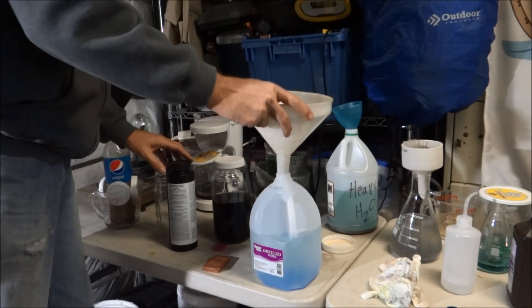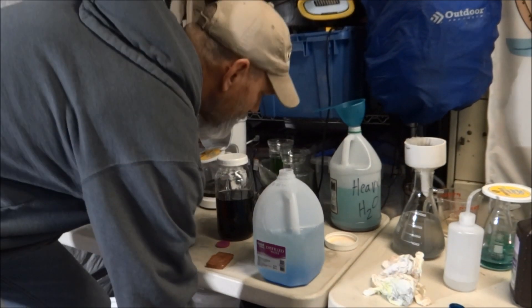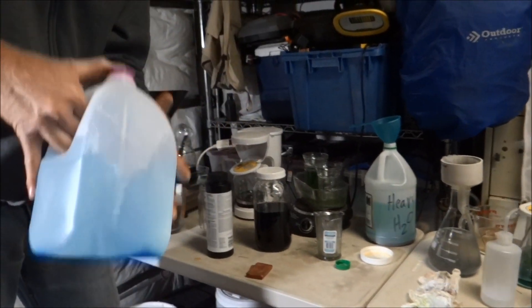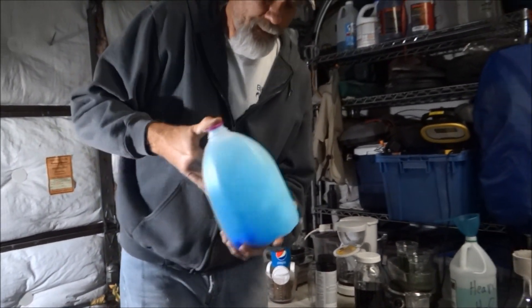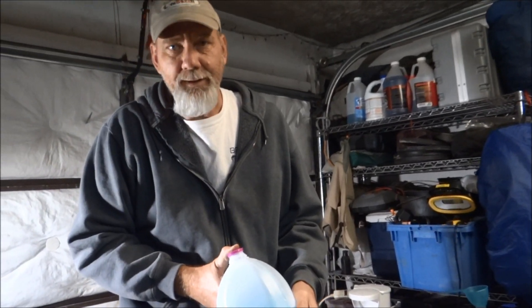I'm going to dissolve the copper sulfate in distilled water - just kind of taking the easy way out here, I'm lazy. We're going to make sure this is all dissolved. Look how beautiful - what a pretty blue! I'll keep shaking this until it's all dissolved.